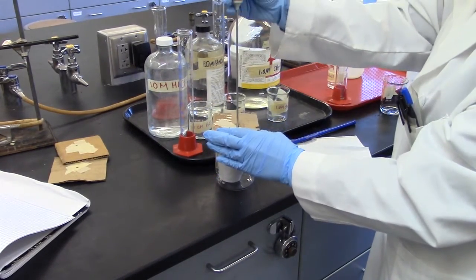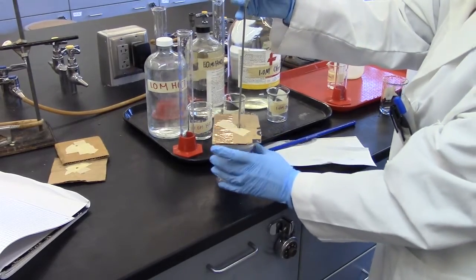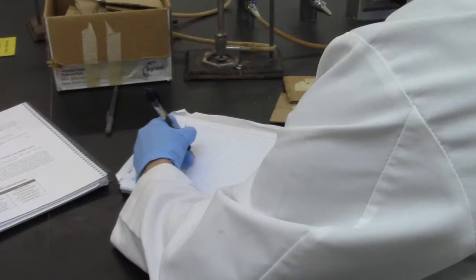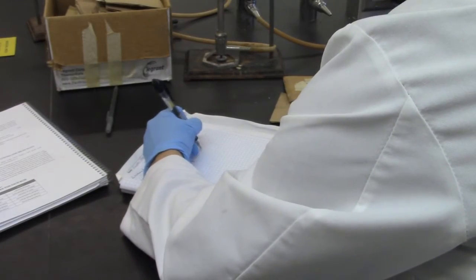Cover, insert thermometer, and stir. Read thermometer and record final temperature.